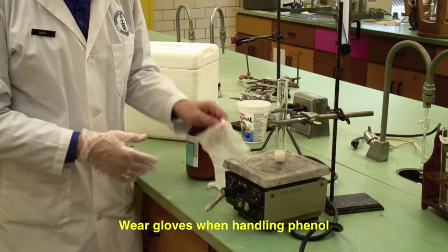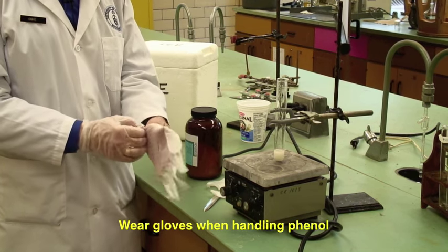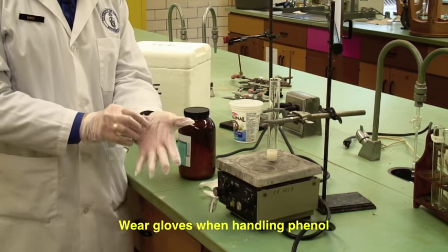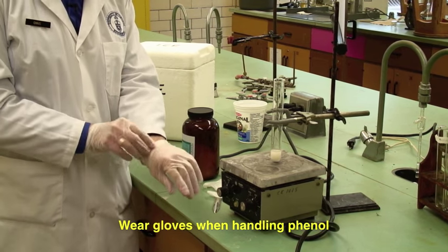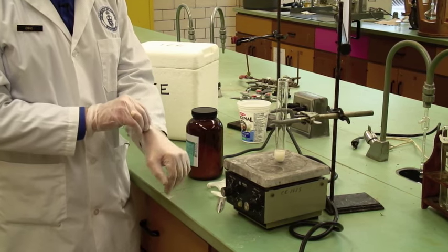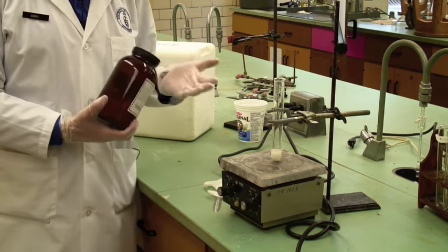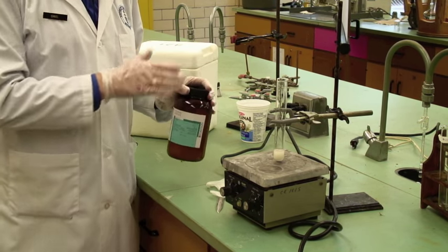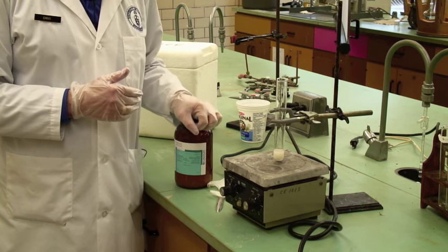Phenol was used as a disinfectant, still is. It smells kind of like a disinfectant, but that's usually a liquid solution of it. The raw solid can burn your skin. So we're using phenol and water and investigating the phase phenomena.